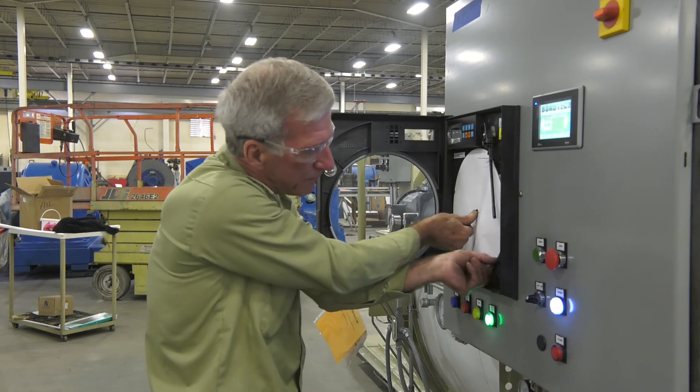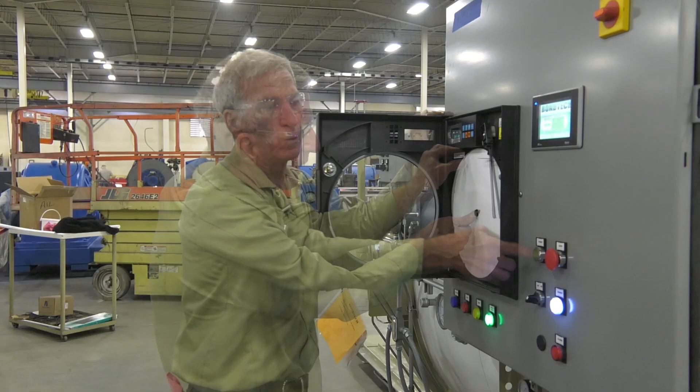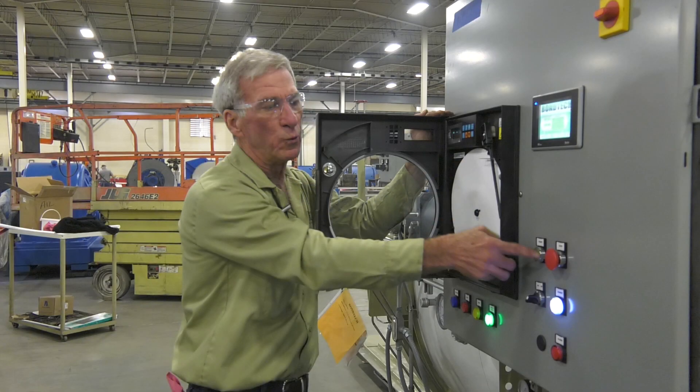Once you verify that the paper is correctly installed under the five tabs, press the pen back down so that it is touching the paper. And finally, press the chart button once again and the pen will start sweeping.